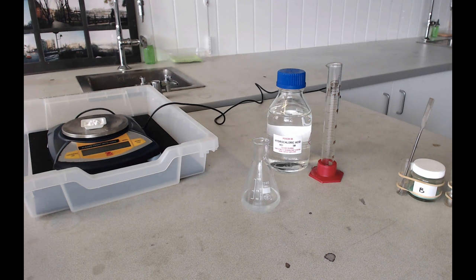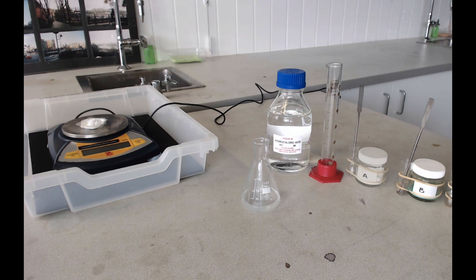We just want to get pretty close to 2 grams. It doesn't have to be exact. Around about 1.9 to 2.1 will be fine. If you spend a long time trying to get it to exactly 2 grams, you'll just block up the balance and no one else will be able to use it.